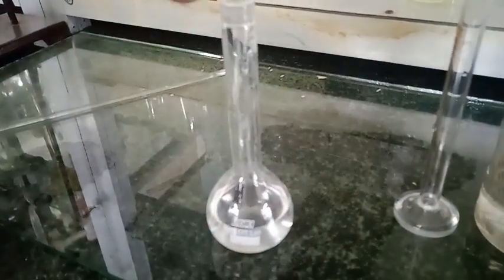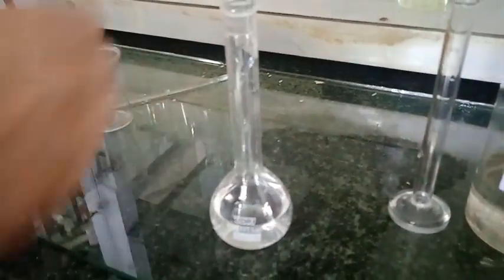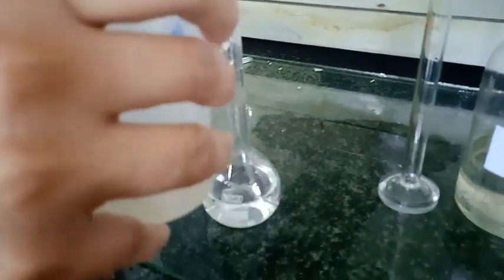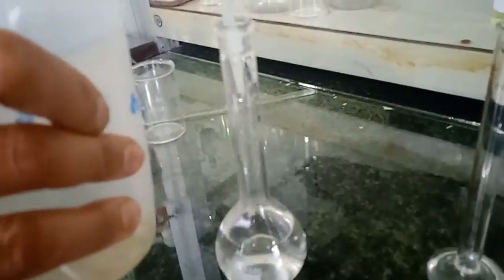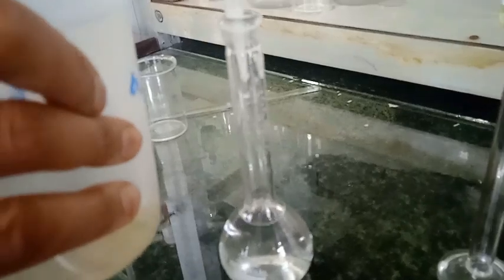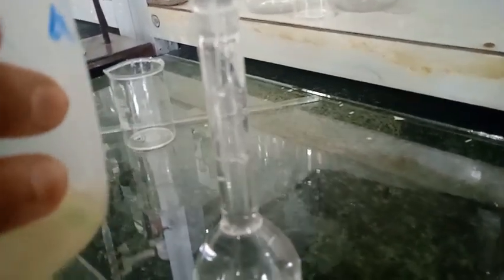Here I am going to make up the water up to the mark, and I am adding distilled water to this measuring flask. Now it is up to the mark—you can see this is our one normal H2SO4 solution.